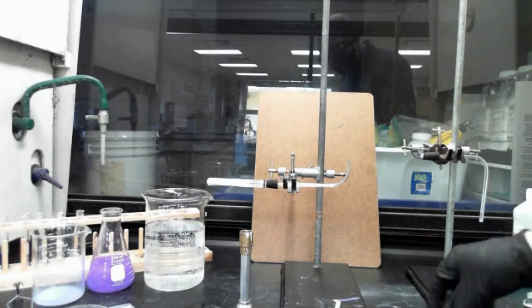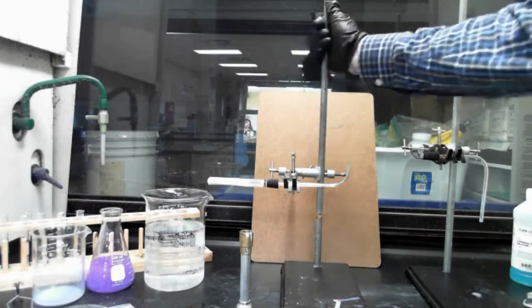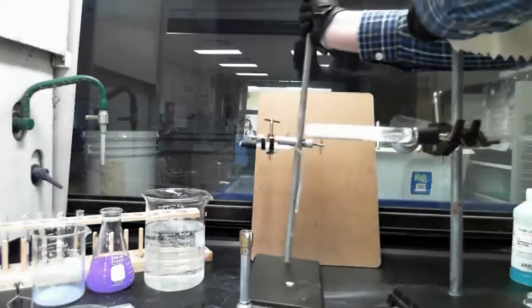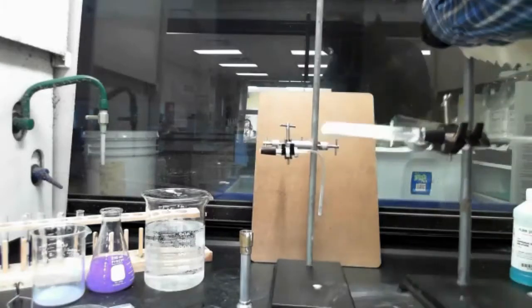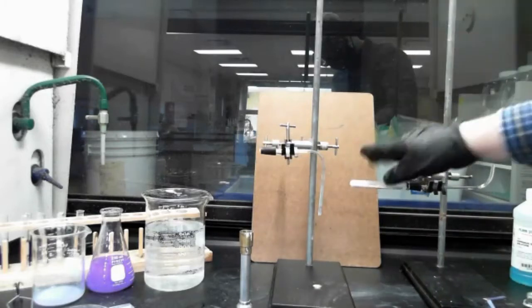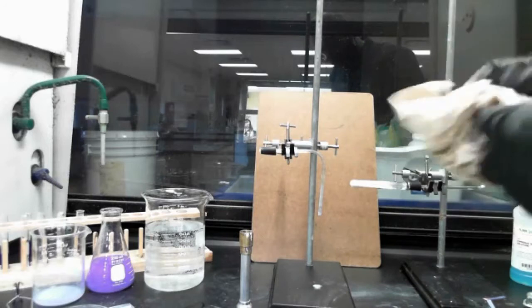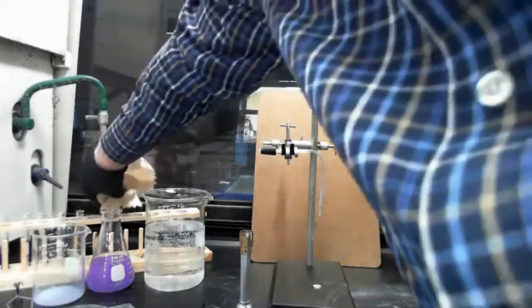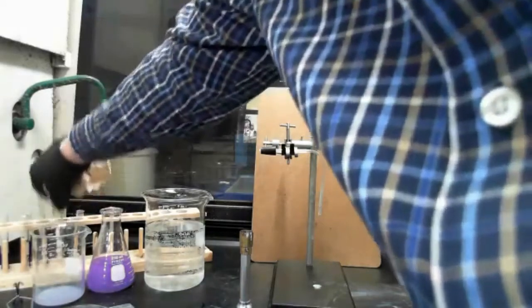Now I need to switch these two setups. So I'm going to move this and move this over. Take this off of here so it's out of the way.